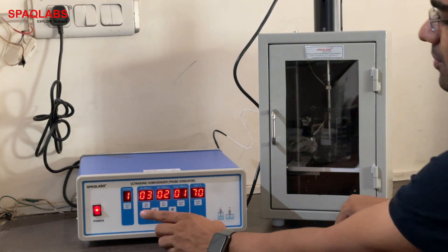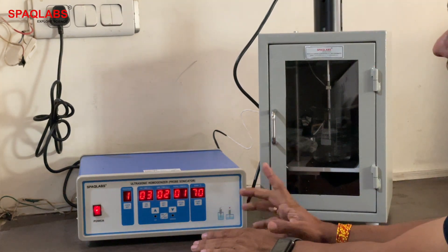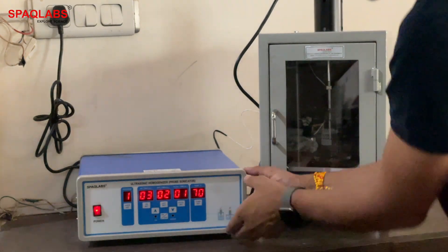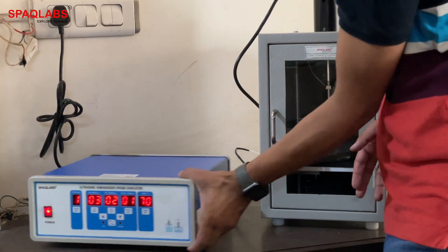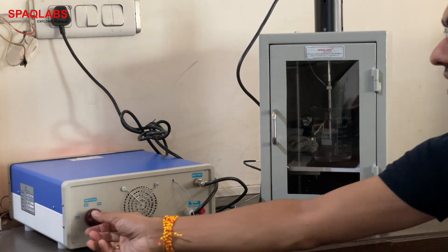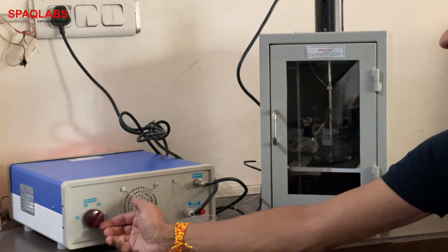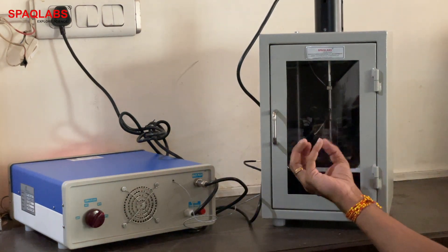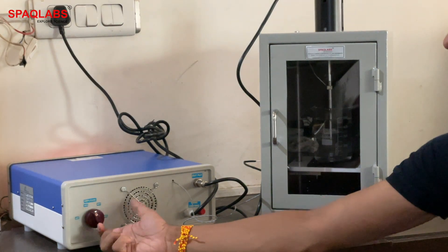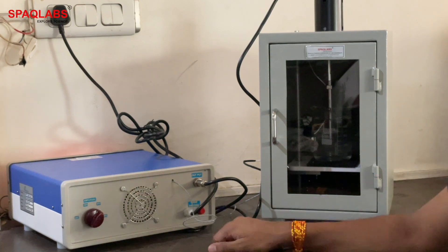The amplitude of the homogenizer is set from the back switch — it can be set to 50% or higher. Setting it to 60% or 80% will increase the amplitude. At 80% or 100% it will run at that amplitude. For now, we will run it at 80%.